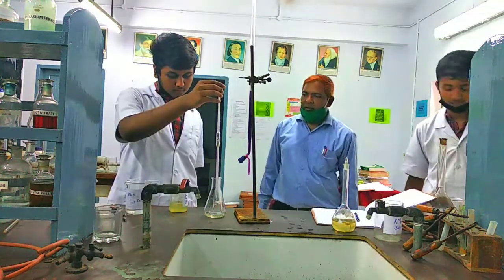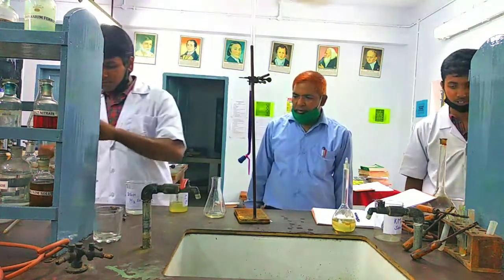Again take one full test tube of sulfuric acid.